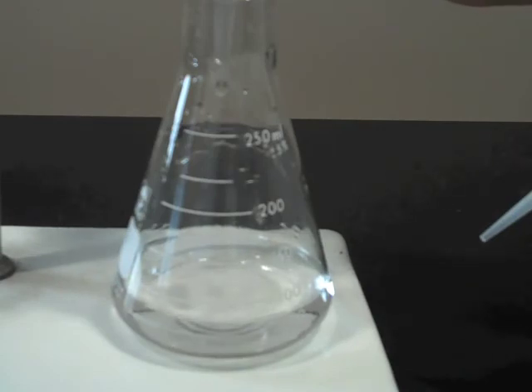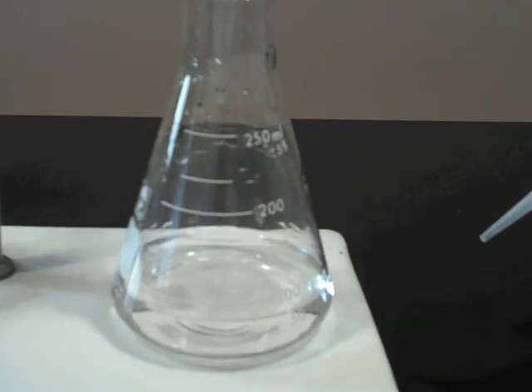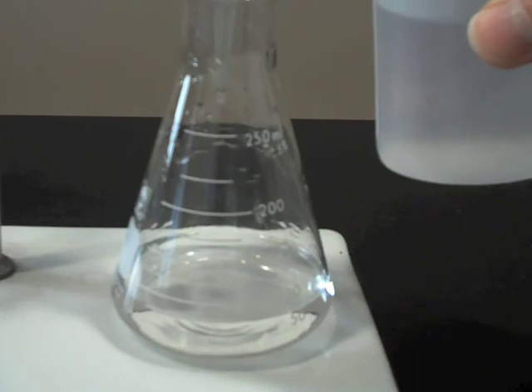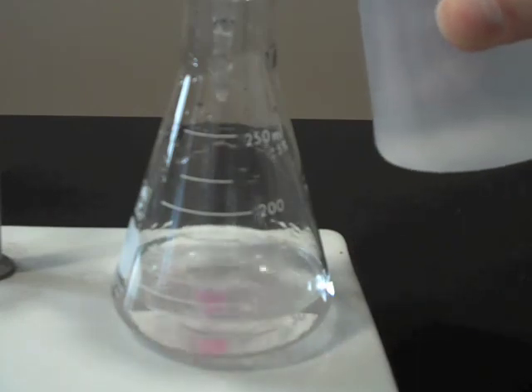Adding small amounts of water does not change the appearance of the endpoint. The true endpoint is, in this case, the first faint color that remains after 15 seconds of stirring.